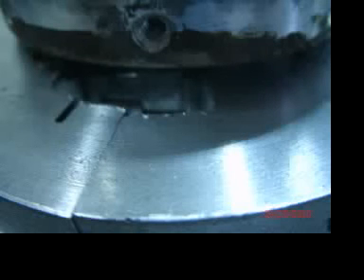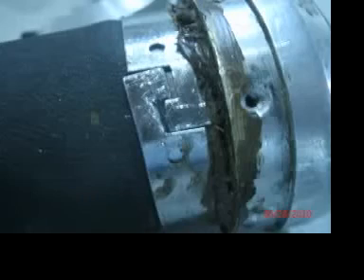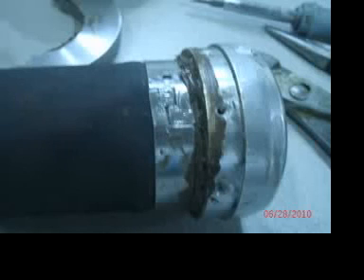Note that in order for the ends of the clamp to lock, the fixture must be butted up completely tight. If there's a gap, the ring won't be correct. Once the ring is at least in this position, it doesn't have to mate completely, but the ends of the tool have to be together, and then you can actually get the ring looking like this. Don't worry if they're not completely mated, at least you can take the fixture off.